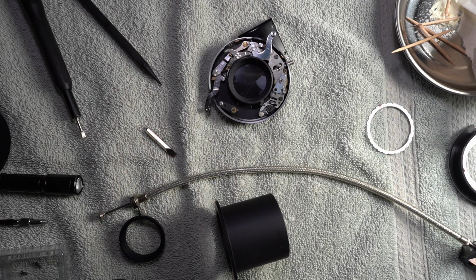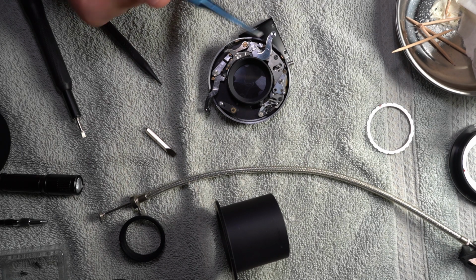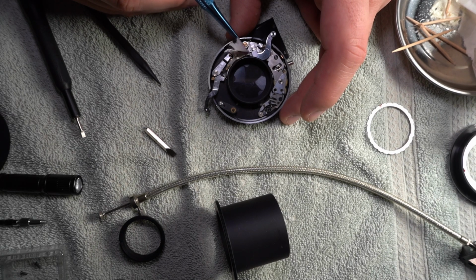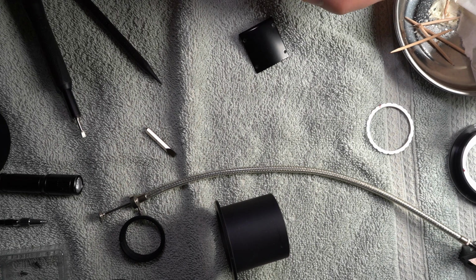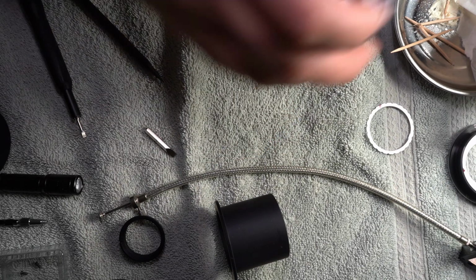But I'm just going to remove that because there's no reason for it to be on top of that whole assembly. I didn't put that there. That's something old, and you can kind of maybe see it there. I don't know if you can or not, but I got a little bit of it off. Just gonna do the same thing for the top of this other part of it. Kind of get in there and get the excess off, because it's just gooey old grease or oil or something. And there's no reason for it to be there. It's not doing anything.